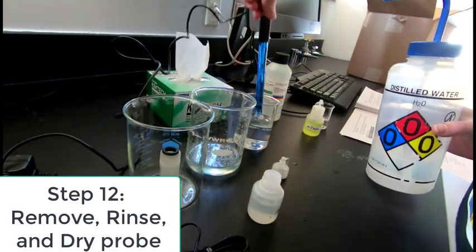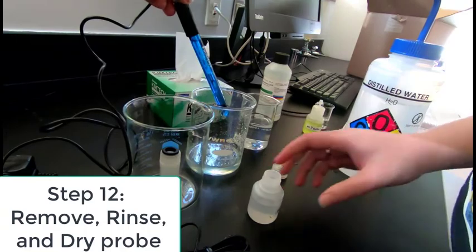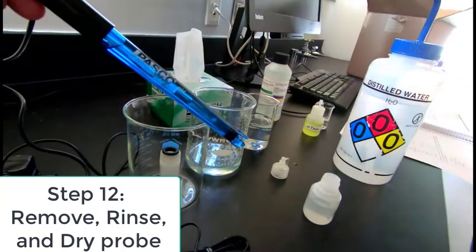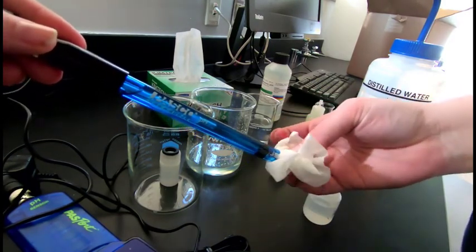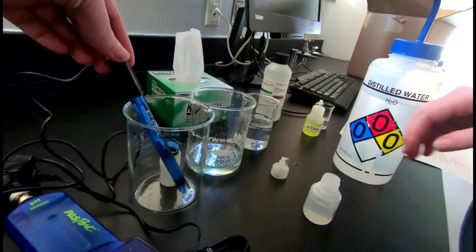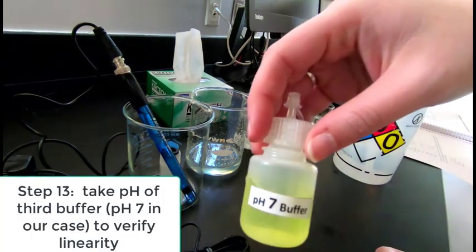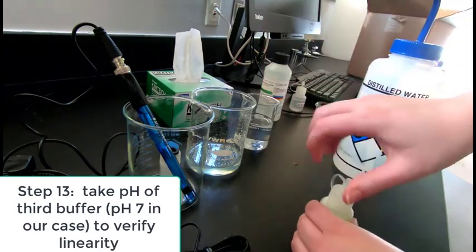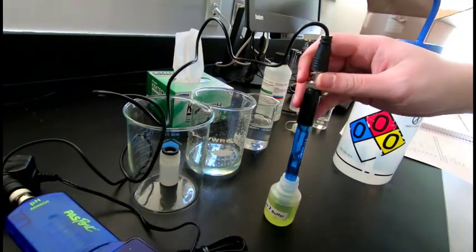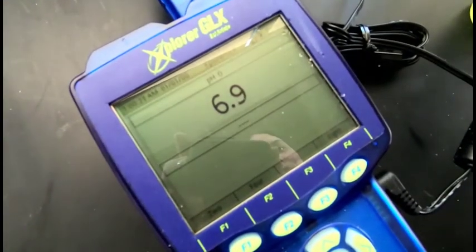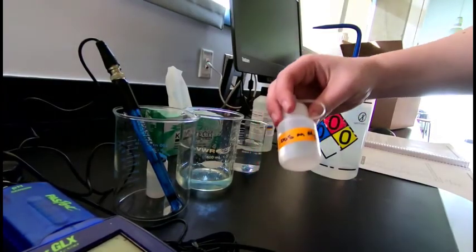So we would be kind of stuck right now because we've basically done a two-point calibration curve. But watch what she does. It's kind of a slick way to kind of get a third point in there without setting up the calibration curve that way. What she's going to do is she's going to drop it in the pH 7 buffer. And if that reads within 0.1, then that'll be like the third calibration point. There we go. And now this is also instructive for you to know that the pH that we read in the lab is good to the tenths point.